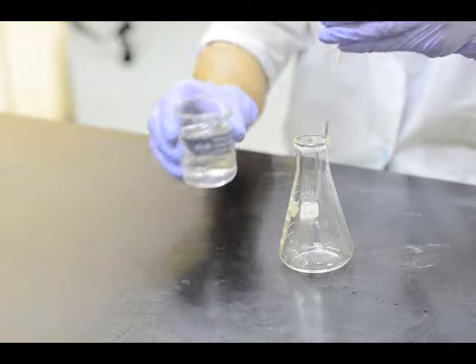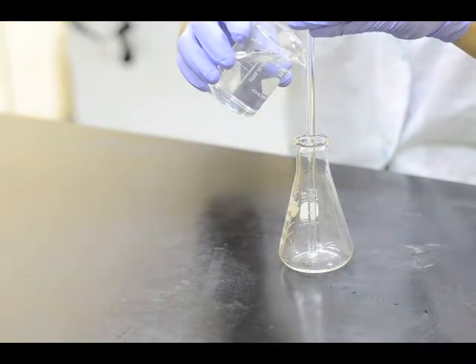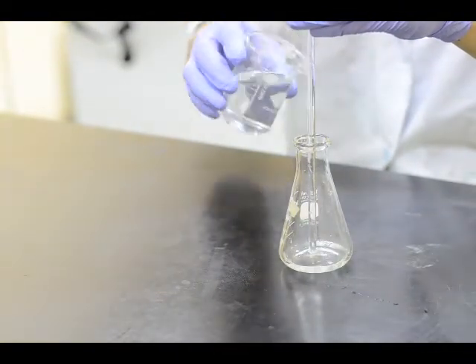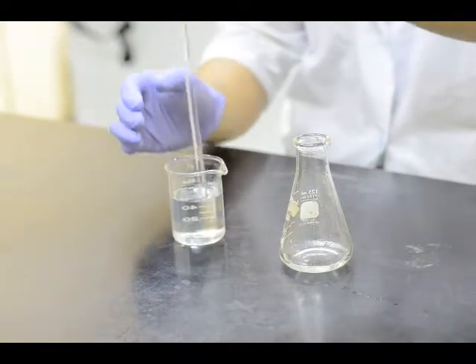When transferring liquids, he uses a glass rod to guide the liquid along the rod into the container to avoid spillage.